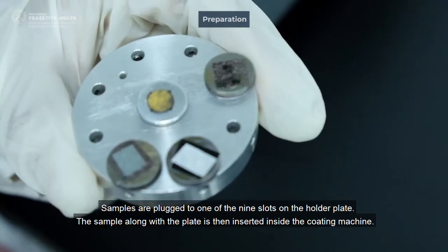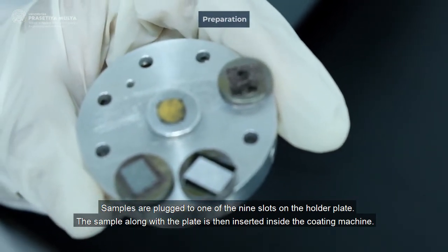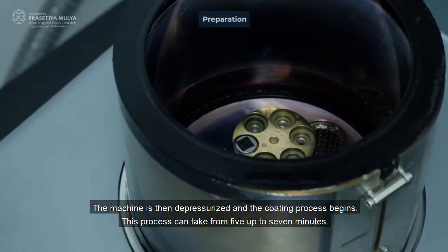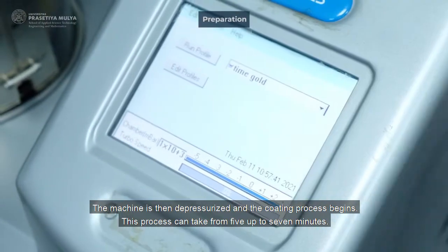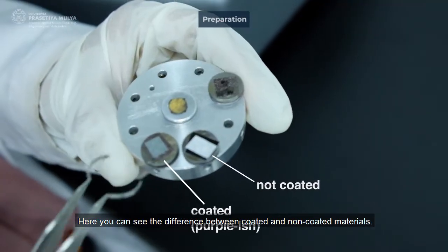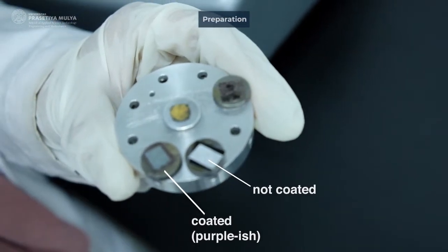Samples are plugged to one of 9 slots on the holder plate. The sample, along with the plate, is then inserted inside the coating machine. The machine is then depressurized and the coating process begins. This process can take from 5 up to 7 minutes. Here, you can see the difference between coated and non-coated materials.